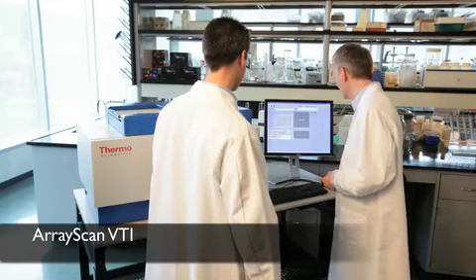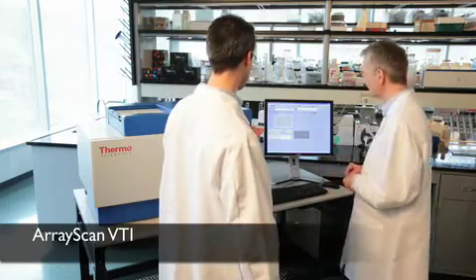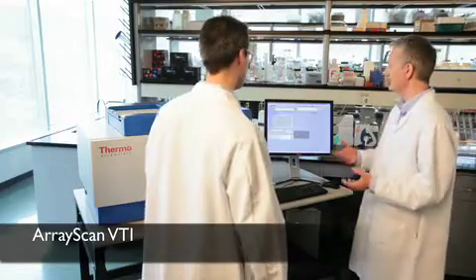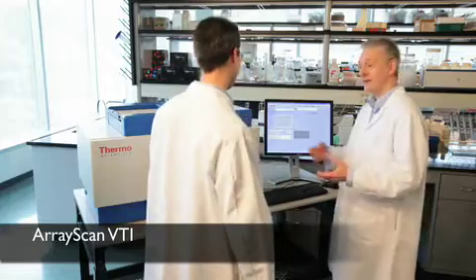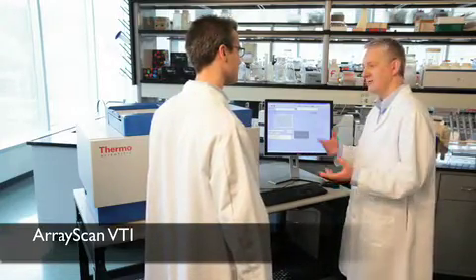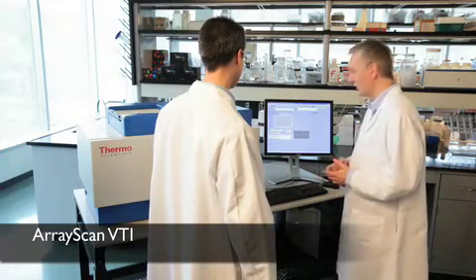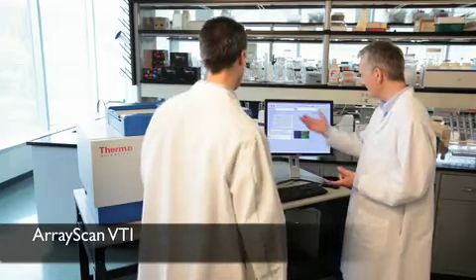So all we really got to do is click scan. This looks so easy. Yeah, like I said, it really is easy. And that's one of the reasons why we got it. It makes us really productive. And because we have lots of people like you coming in every day with different kinds of biologies, it allows us to be really flexible. So it started up. It takes a little moment to autofocus on the cells in the plate.